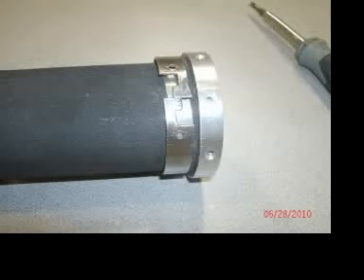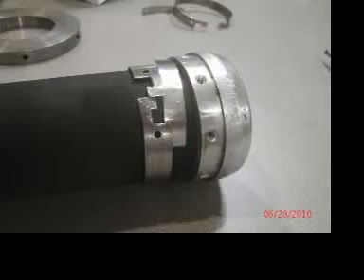and it will look like this. Please note that, repeat it on the other side. And note the small shim strips underneath. Save those and don't lose them. They're very important. You'll need them when you put the core holder back together.